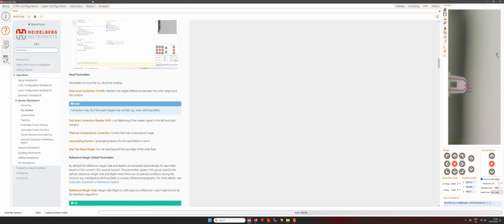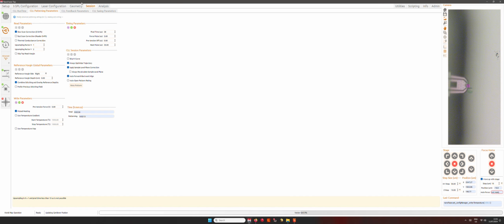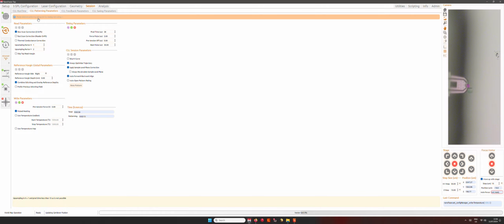Hello everyone, so in this video I would like to show you how the Z drift correction or slow scan correction works, and mostly I would like to explain to you what it is, because it's the only correction in the read parameters that is always by default active. And first of all, what is it? How can we define this correction?